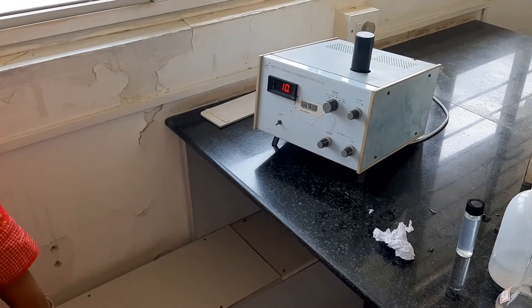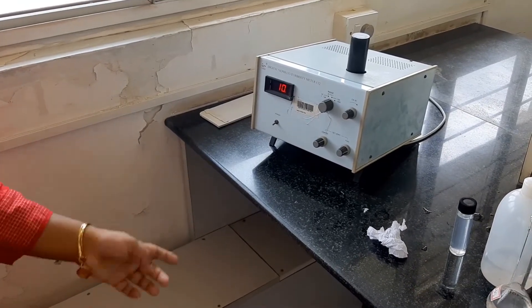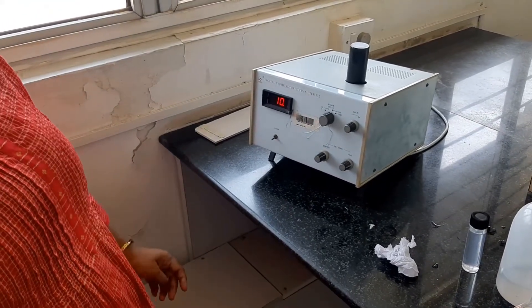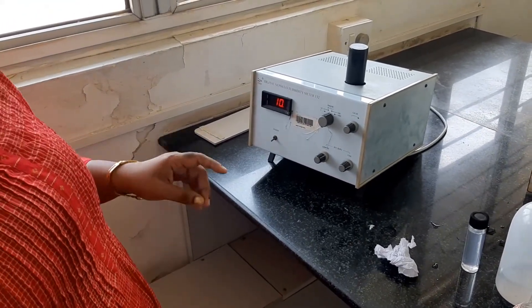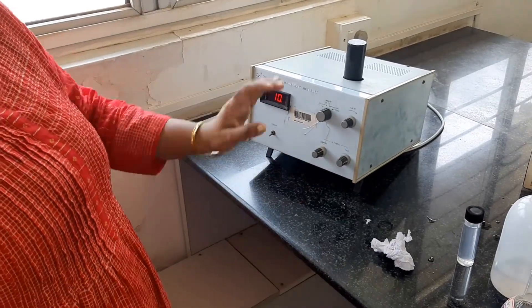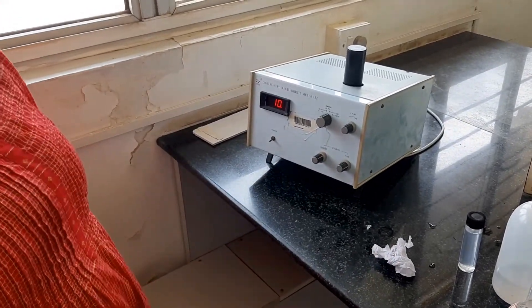You have to do this for 2 to 3 samples. Here I am doing it for 1, but we are going to do it for 2 to 3 samples. Only for the calibration do we have to operate the controls; for the rest we just note down the value.